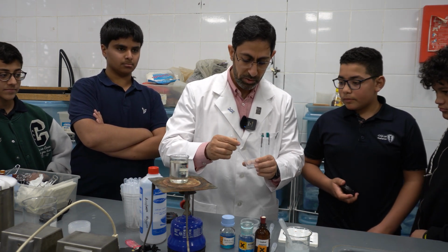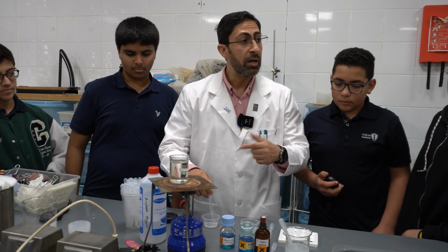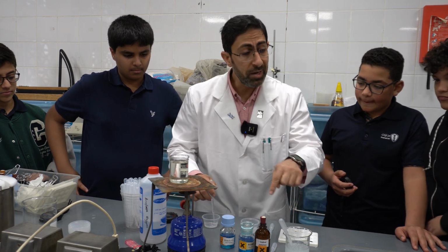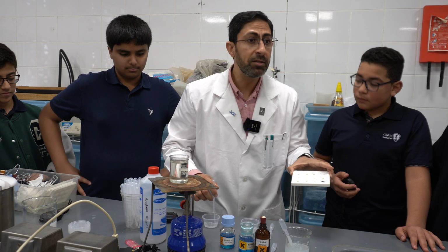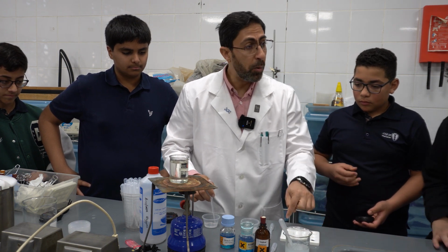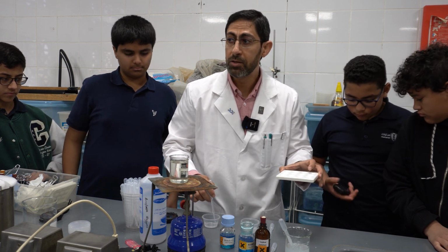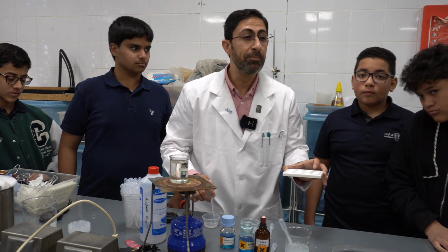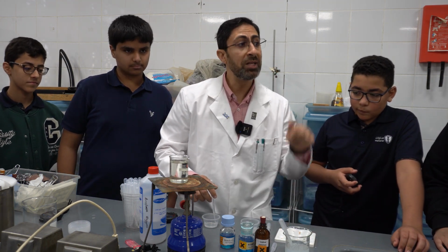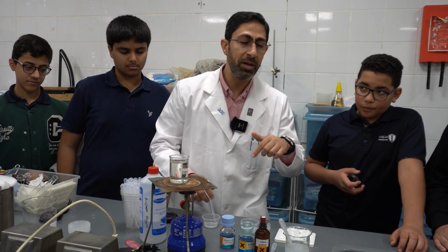So, the experiment goes like this. I will add the amylase to the starch, and afterward, every 30 seconds, I will test the presence of starch. If the color of the iodine changes into blue-black, it indicates that the starch is still present and not digested. If I come to a point where the color of the iodine reagent remains the same, this indicates that there is no starch present and all of the starch has been broken down by the amylase enzyme and converted into disaccharide maltose. When I come to this point, I will test the presence of the disaccharide maltose, or the reducing sugar, by the Benedict reagent, which will be our third experiment.